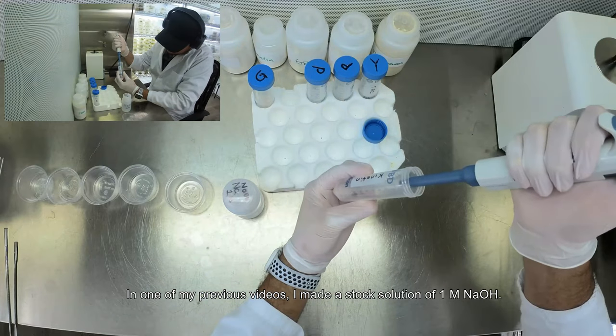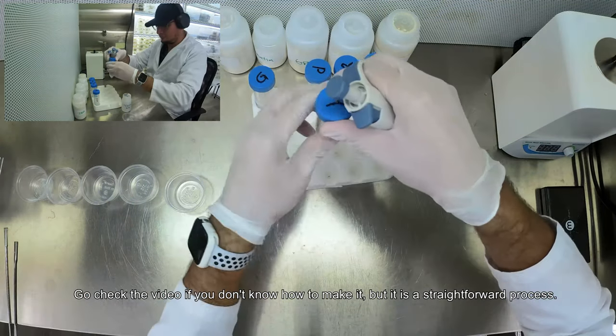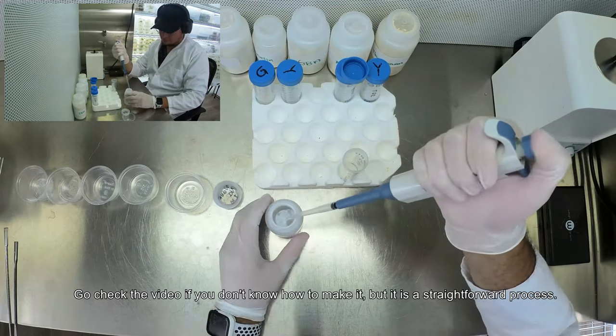In one of my previous videos, I made a stock solution of 1 molar sodium hydroxide. Go check the video if you don't know how to make it, but it's a very straightforward process.